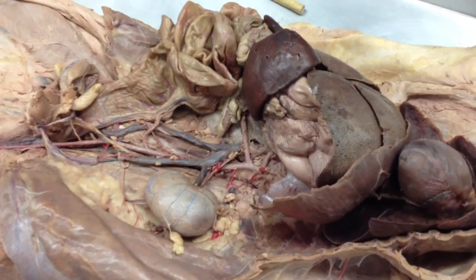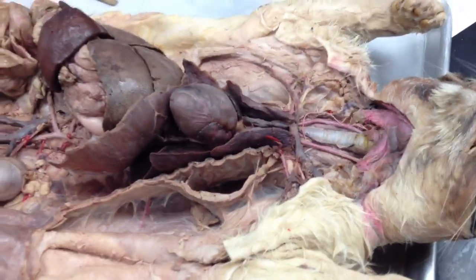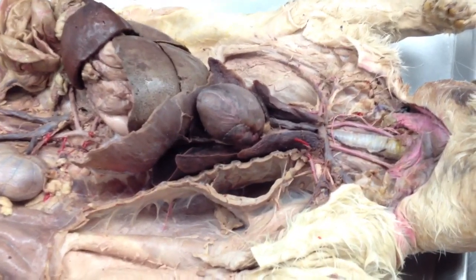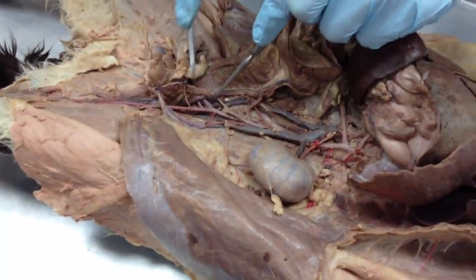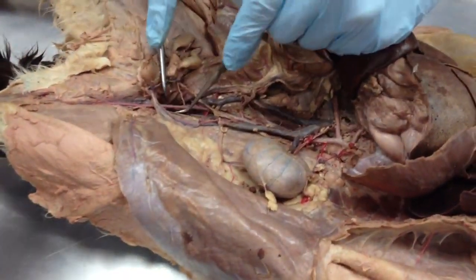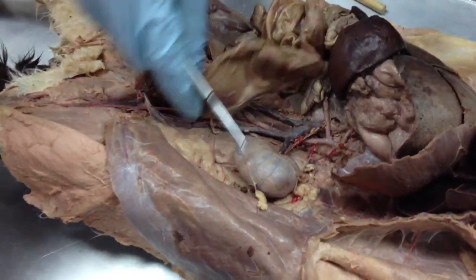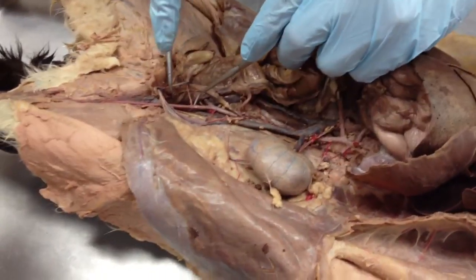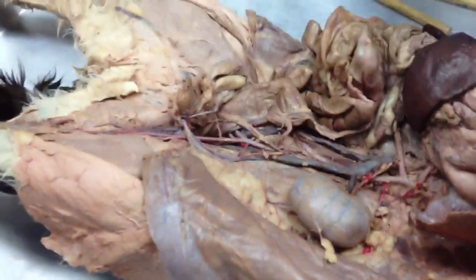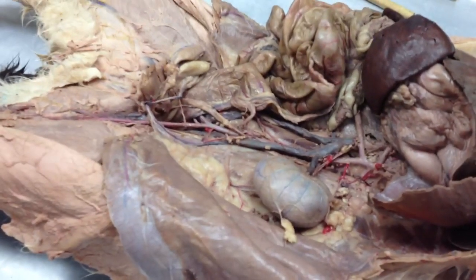I told you about the external and internal iliac vein. Apparently they aren't very visible. Again, this inferior vena cava should be branching right here just like the aorta, and if I have this blue vein pinned anywhere in that area, or on this side for some reason, and you answer iliac vein, you're good, because that's where the iliac vein is.